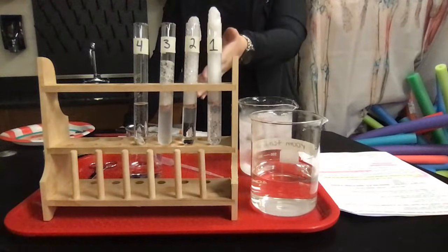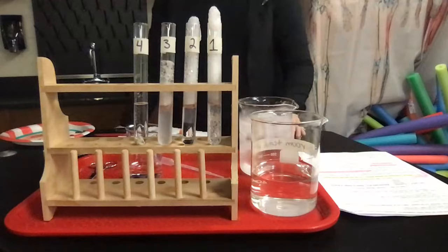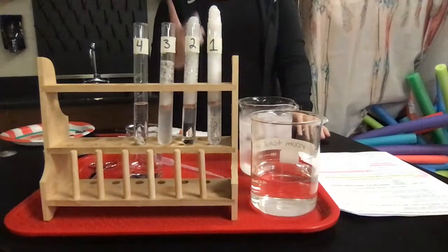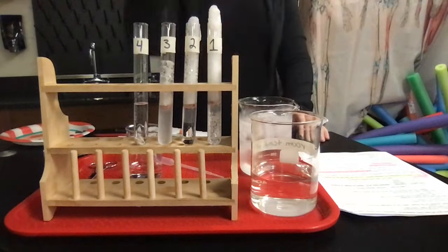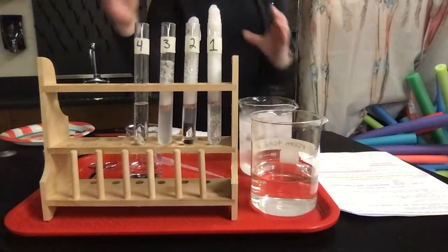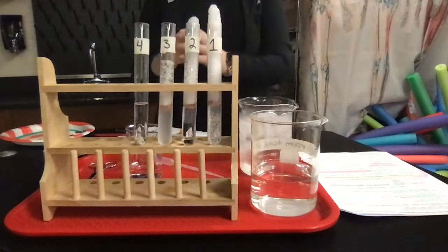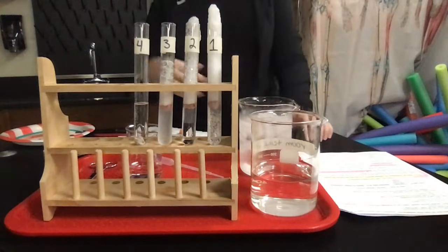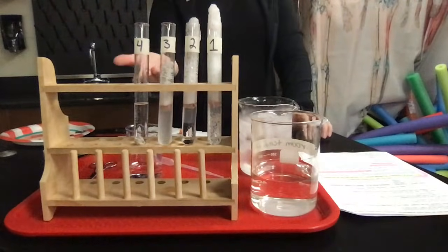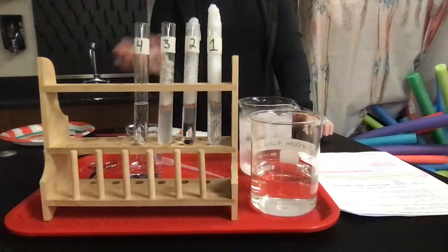It's definitely denatured, which means that you've changed the shape of the enzyme. And remember that enzymes and substrates work like a lock and key together. So the shape of our boiled liver has physically changed, which means that the substrate, the hydrogen peroxide, is not going to fit inside of that correctly anymore, right? So that's why we don't see a very high rate of reaction here, because I've denatured it, and that doesn't work anymore. Okay, so this is part 2.